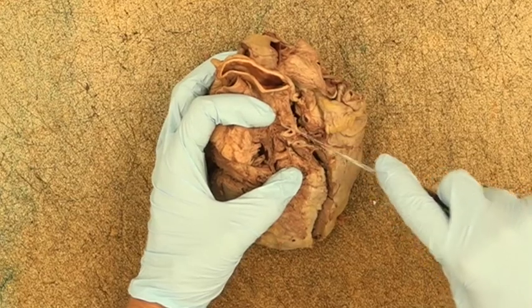Here, you can see a close-up view of this heart's right coronary artery after sectioning. You can see that the vessel's patency varies from the proximal portion on the far left to the distal portion of the vessel on the far right. The left two sections have approximately 50% occlusion from what appears to be an atherosclerotic plaque. See the laboratory guide for more explanation about blockages of coronary arteries. A blockage greater than 75% is considered clinically significant.